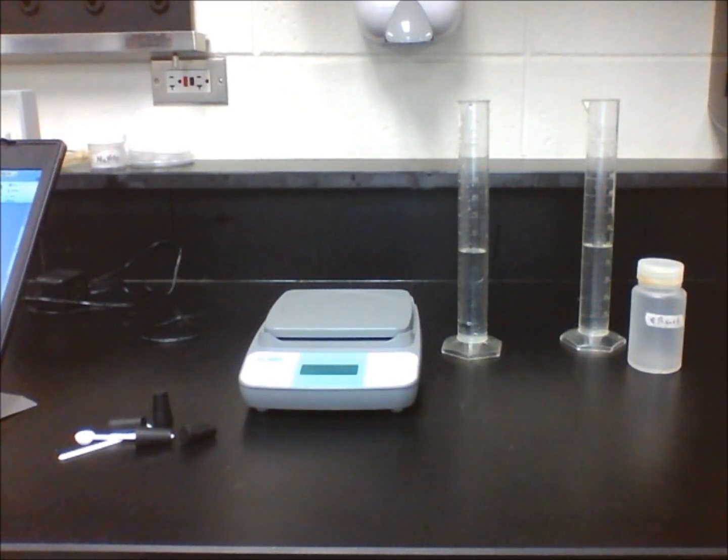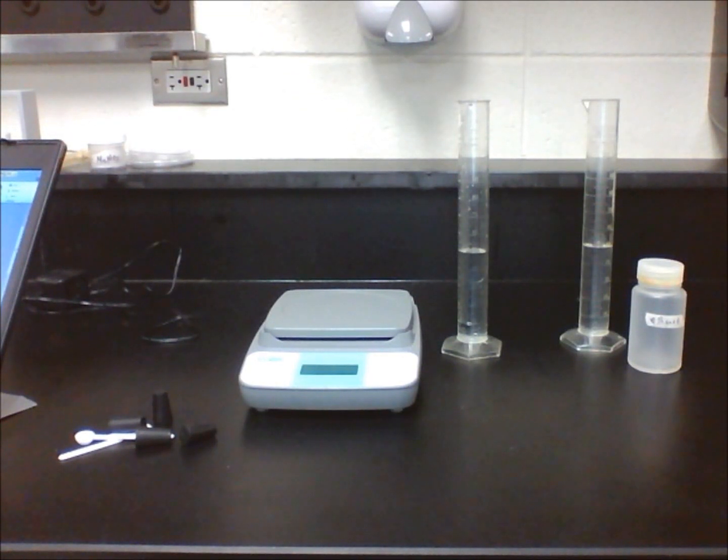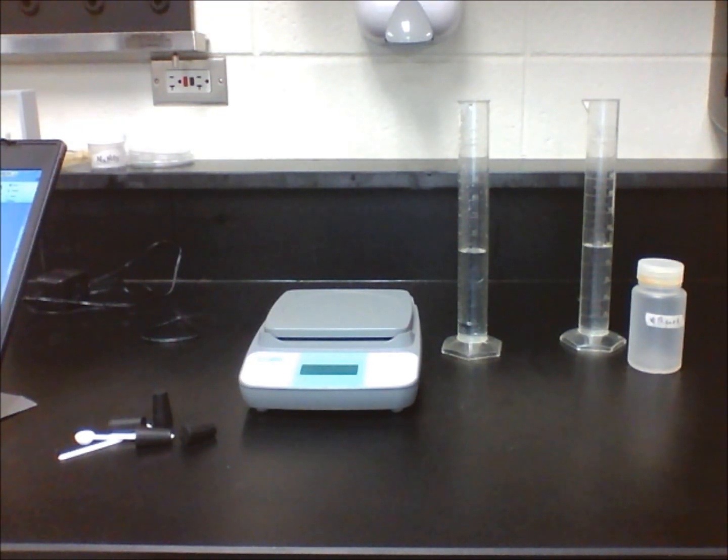In this lesson, we will see what happens to the volume and mass when we are combining two liquids into a solution.